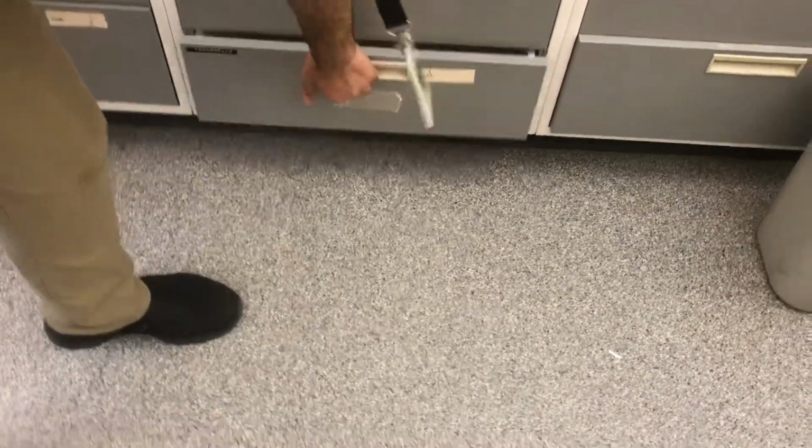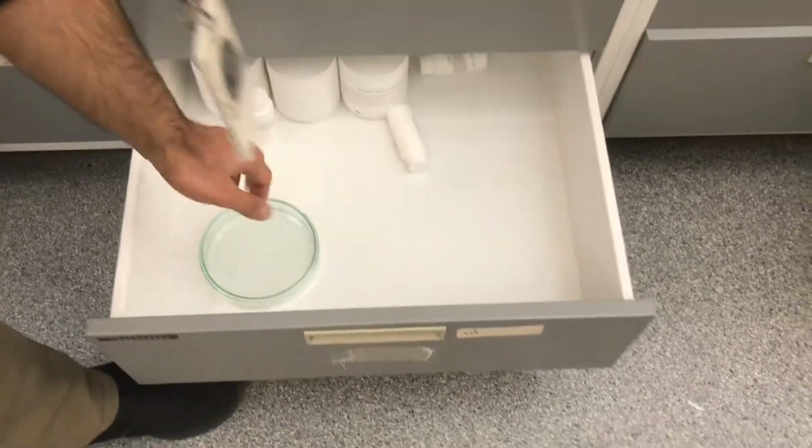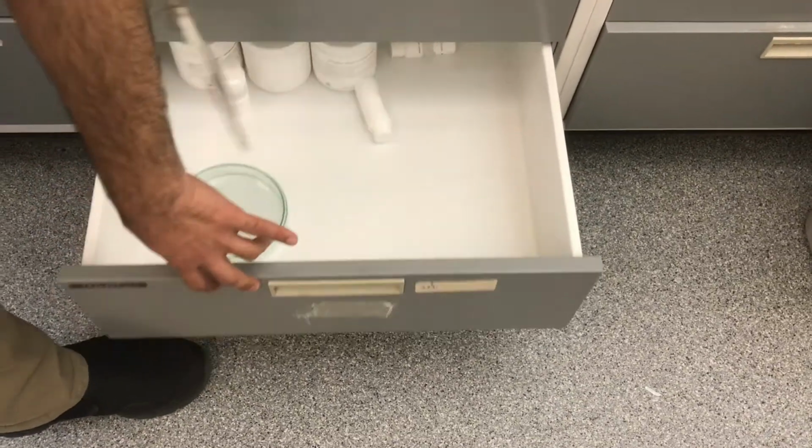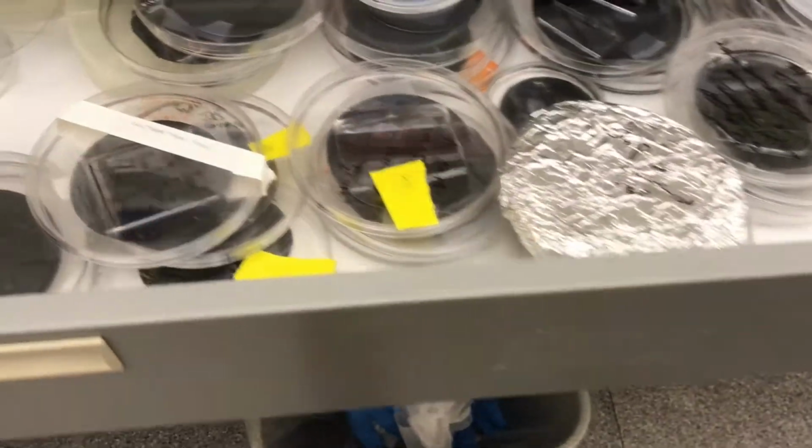And we put the PDMS and everything here. These are the stores for PDMS and curing agent. And all the prepared photo masks, we put them here.